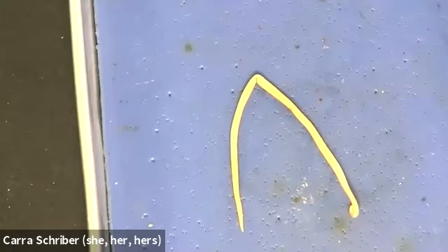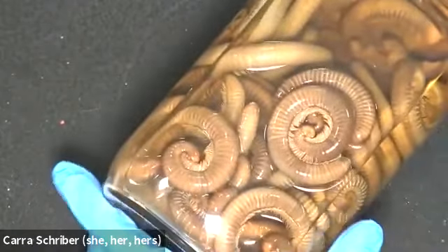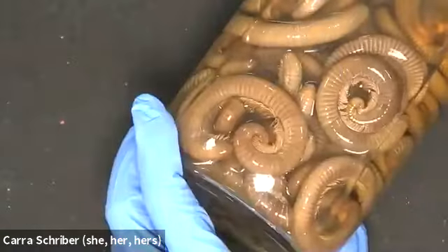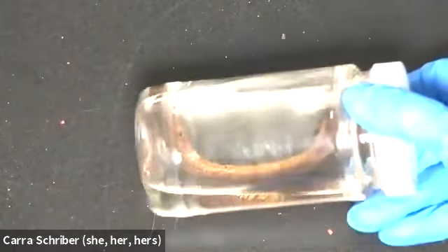All right, and the last group I want to look at, we're not going to actually look at any microscope slides of these. This is just going to be kind of a romp through the arthropods. So I just want to show you some arthropods. So here we have some, I think these are millipedes. And so we've got some millipedes. That's an arthropod.